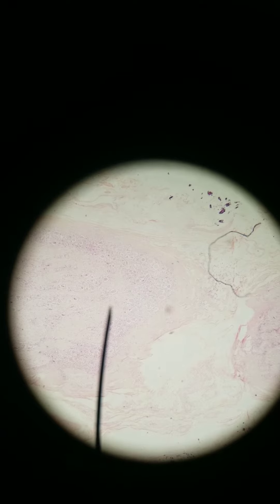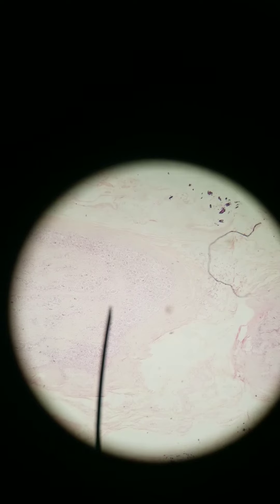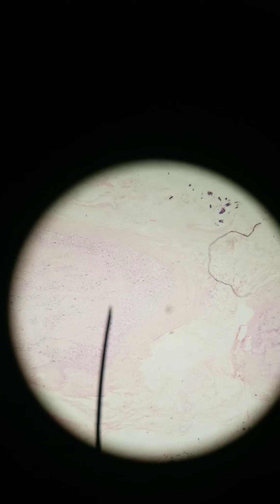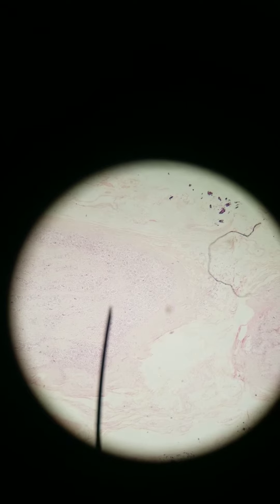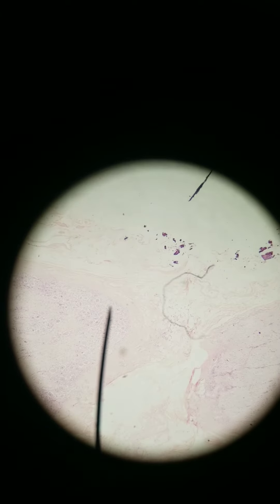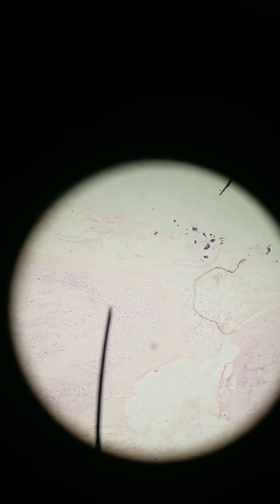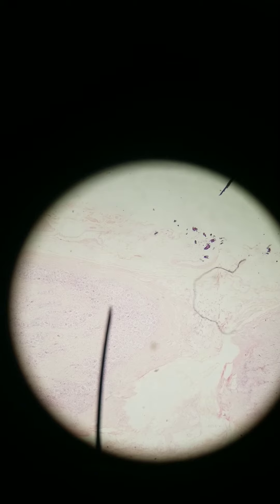Right now we are looking at the dorsal root ganglion. A ganglion is a collection of cell bodies outside of the central nervous system. You can see cell bodies of neurons where I'm pointing. We're at 40x right now, and this is outside the central nervous system — so it's the dorsal root ganglion.